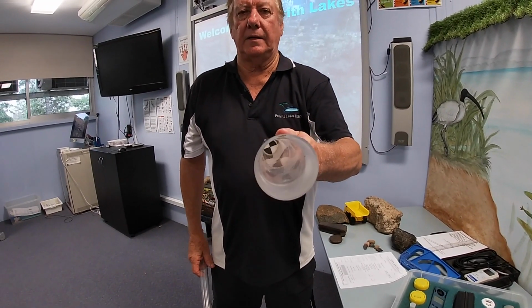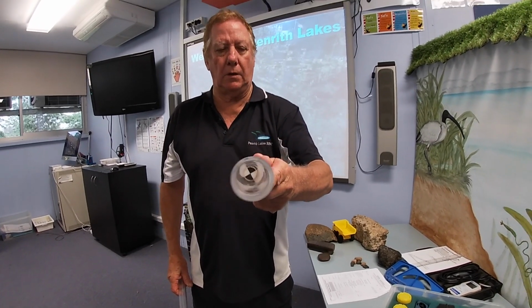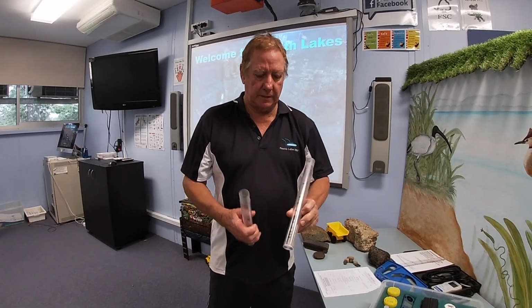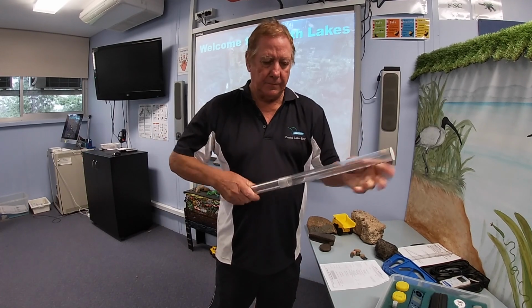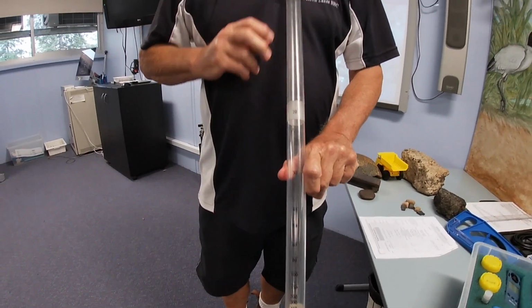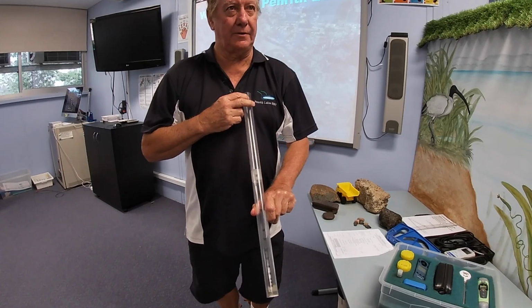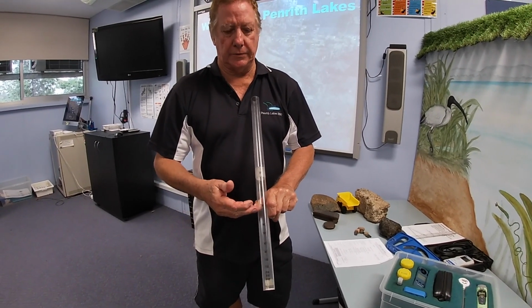First thing is that the bottom of the tube is a black and white quadrant. In this case there could be squiggly lines, in this case it's quadrants, black and white. That's important. Second thing that's important, when we put the tube together, you'll see up the side there are a series of numbers. These numbers are quite weird. These numbers are called nephelometric turbidity units, and you don't have to remember that, just call them NTUs.